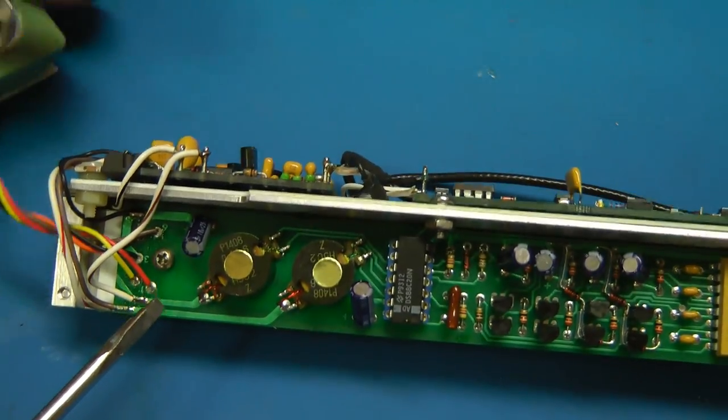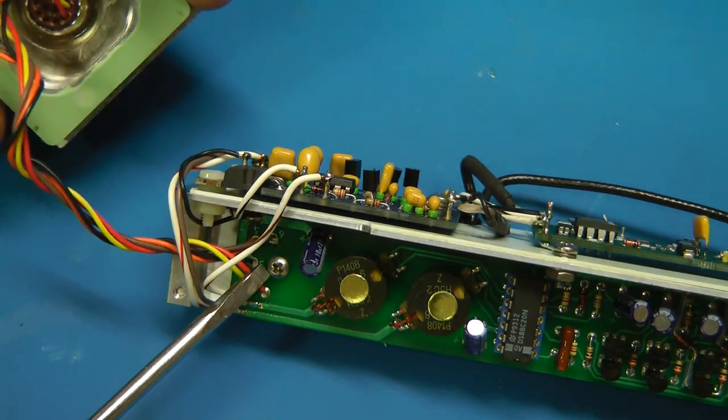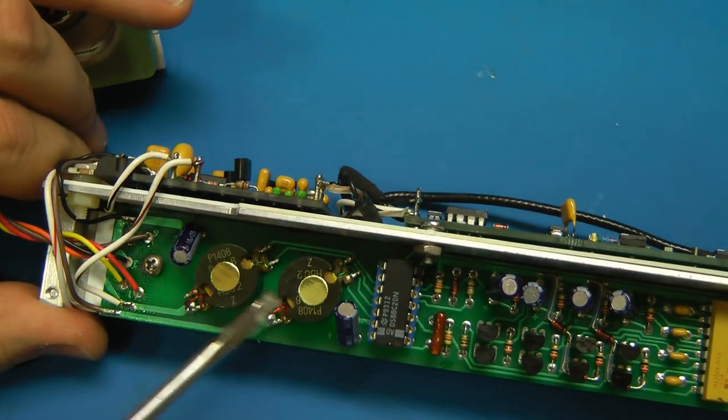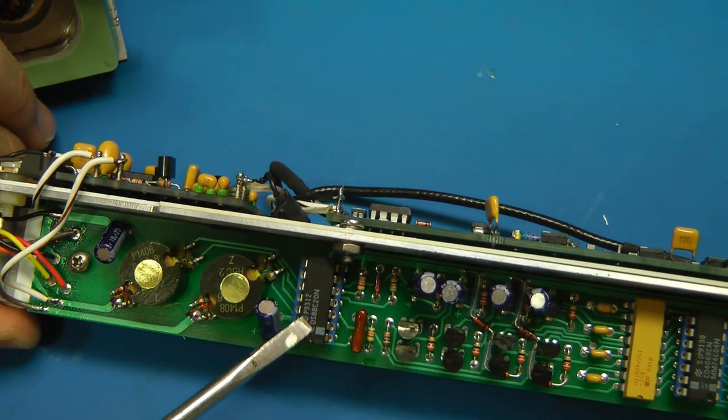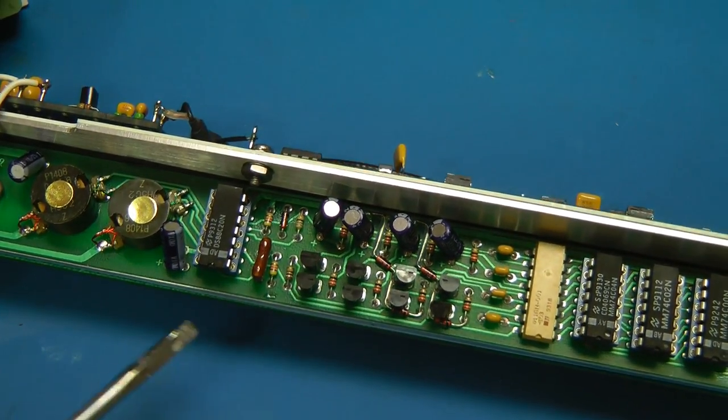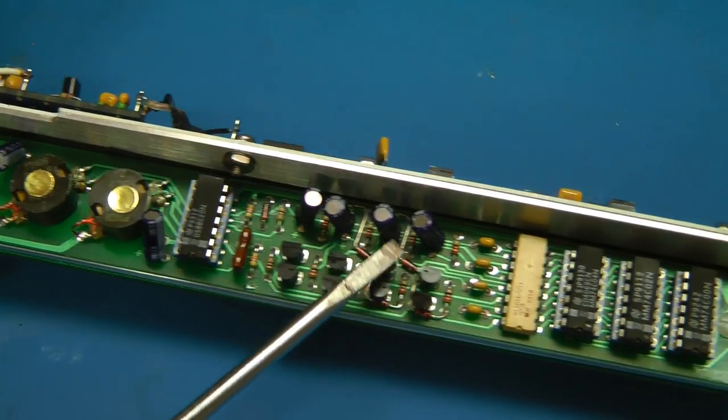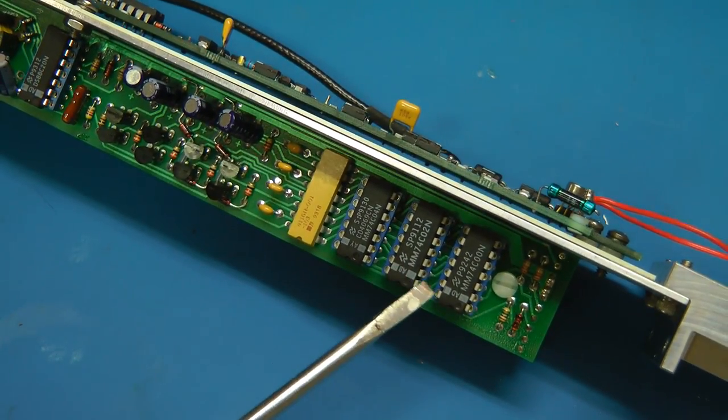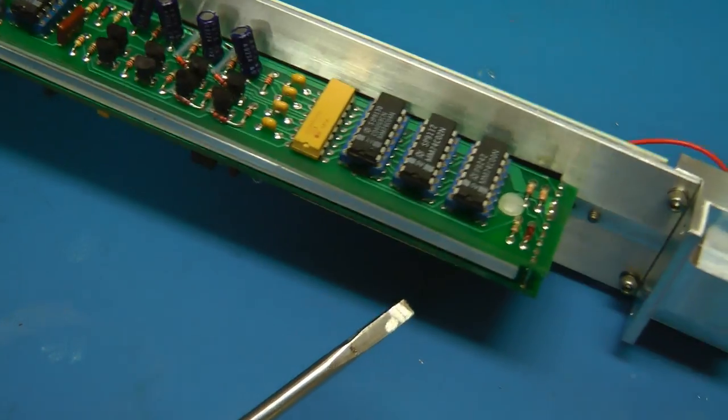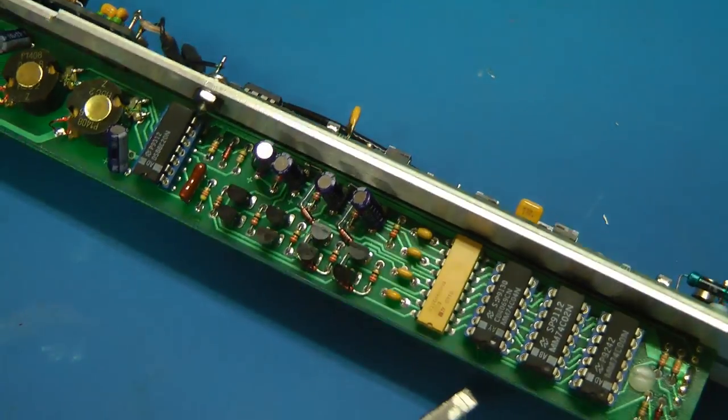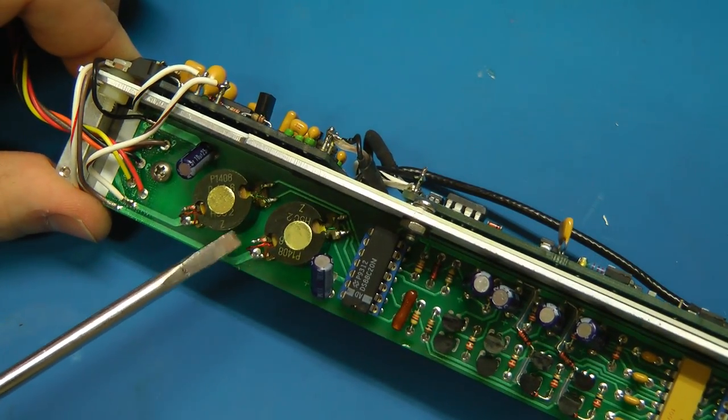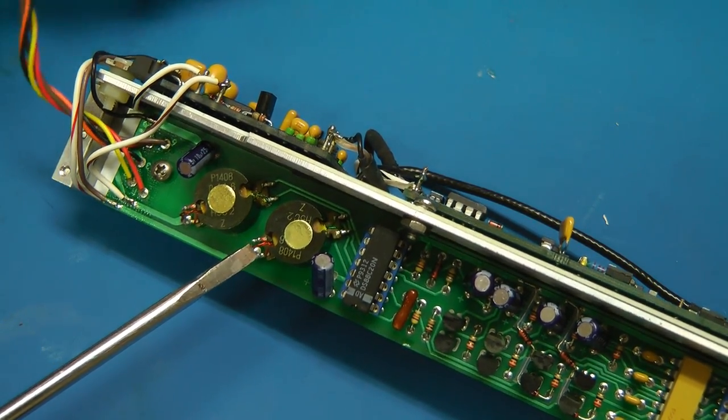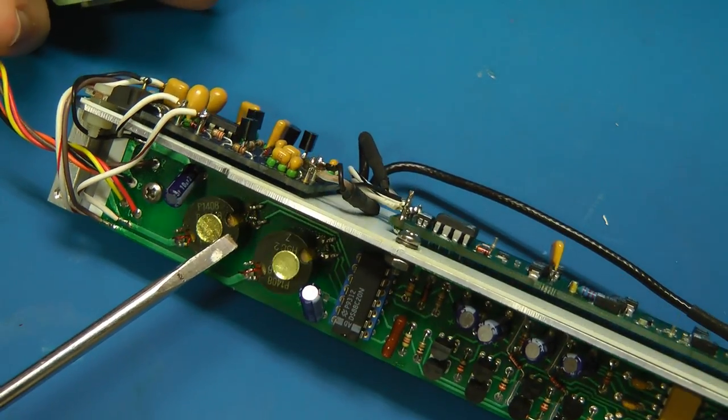On this side, this appears to be some sort of switching power supply. There's these transformers which connect with connections going into this chip. It's possible they're pulse transformers of some sort. And all of the connections out of this go through this thing. Actually come to think of it, given that these transformers are connected up near the cable, I think these are probably some sort of an isolated data communications thing. Because that explains why they're going on directly onto this chip. And there's just some other discrete transistors, some diodes, caps, and a bunch of 4000 and 7400 logic. Yeah, so this is likely the data communication board.